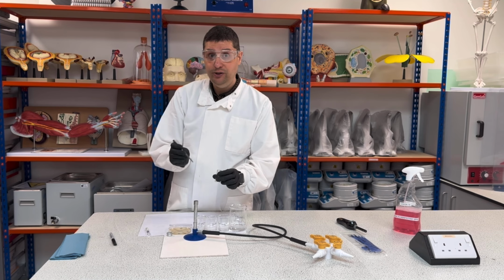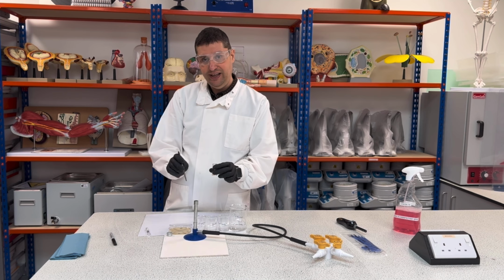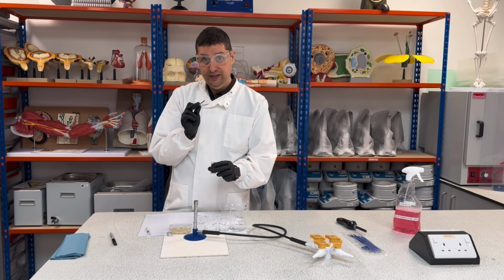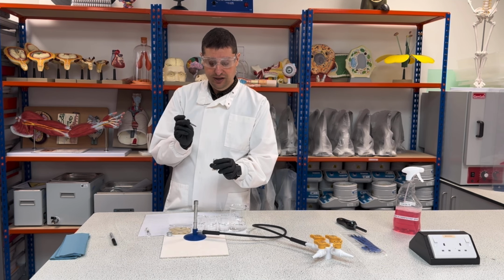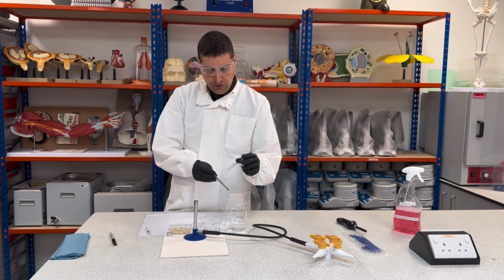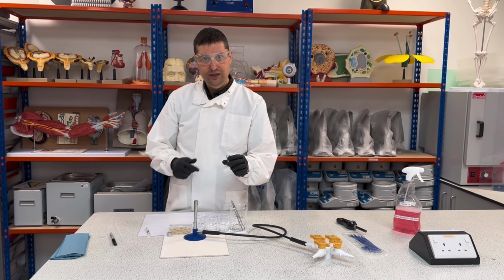Be very careful when you place your disc in the agar, because you don't want to touch the agar, the bacteria, with the tip of the tweezer to avoid contamination, okay? Because when you're gonna collect again, this might be still contaminated. Although we're gonna also put it back here.